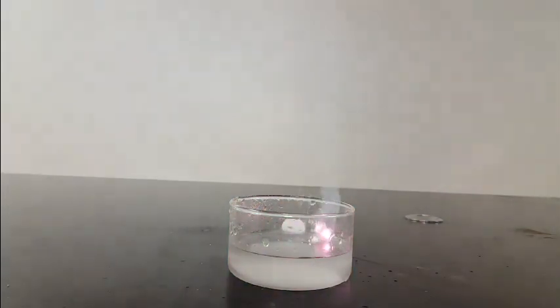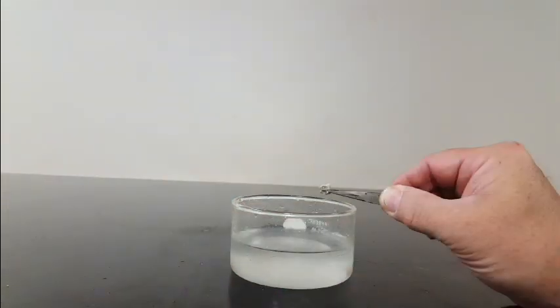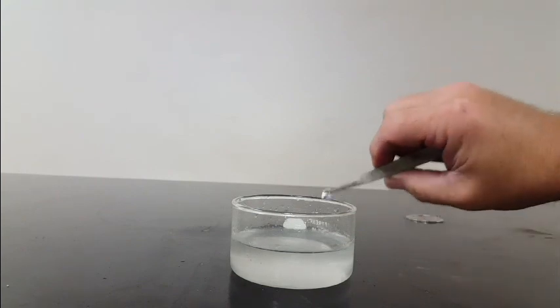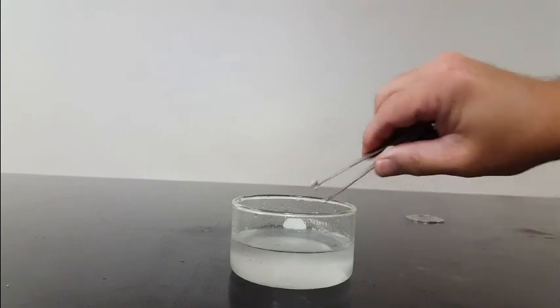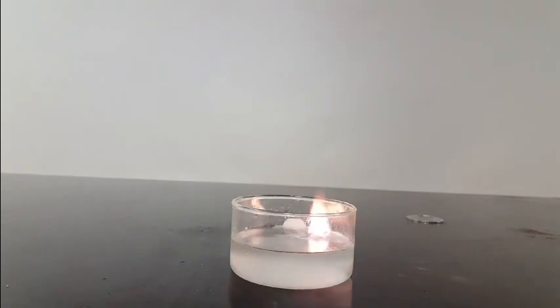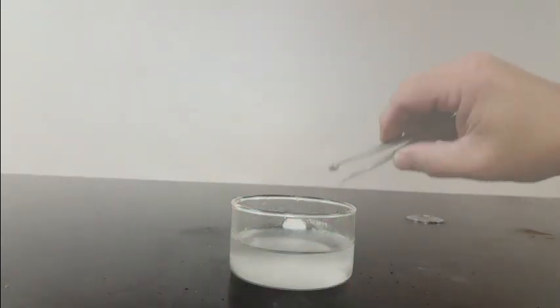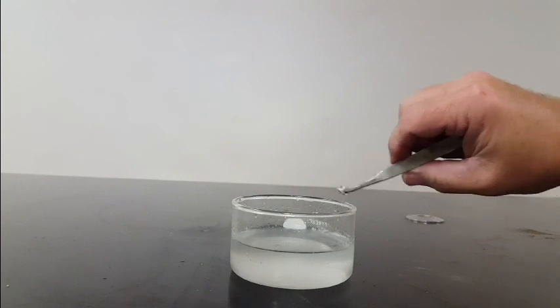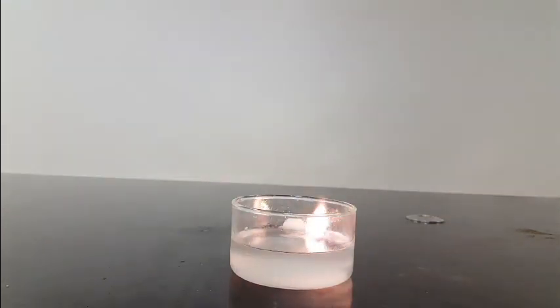However, it's a little more violent. Potassium is reacting with water to make potassium hydroxide and hydrogen, but this reaction releases enough energy to ignite the hydrogen. The flames you saw were the hydrogen being ignited by the heat of the reaction.